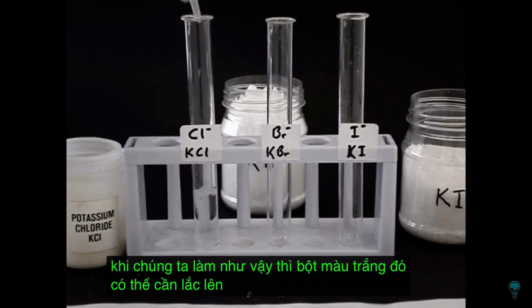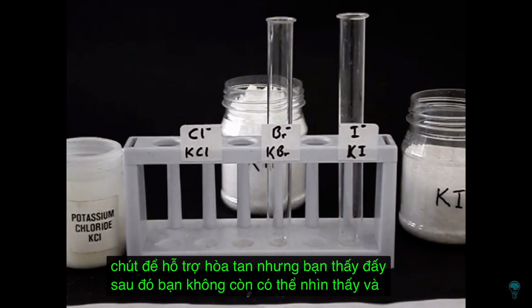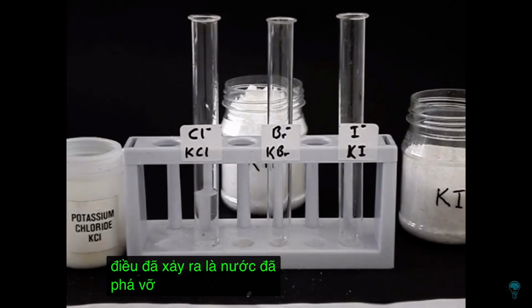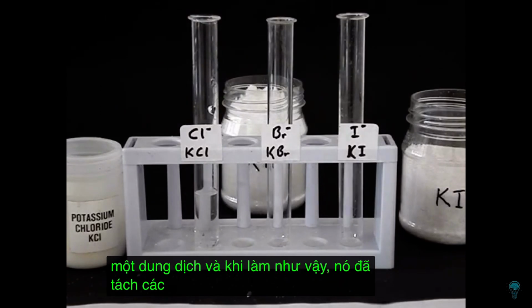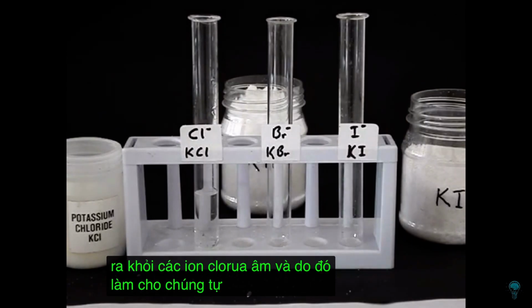You might need to shake it up a bit just to aid dissolving, but you see that then you can no longer see where the white particles are, because what's happened is that the water has dismantled the crystal lattice and made a solution, and in so doing it has separated the positive potassium ions from the negative chloride ions, and so made them free to move around.